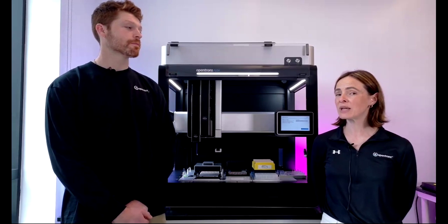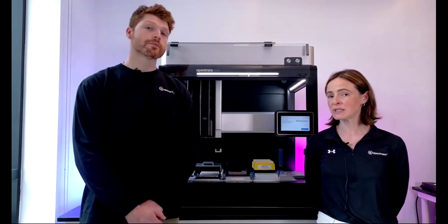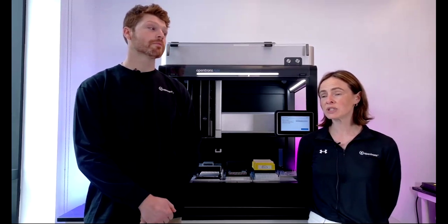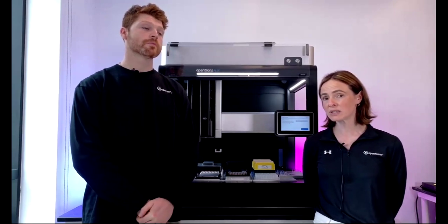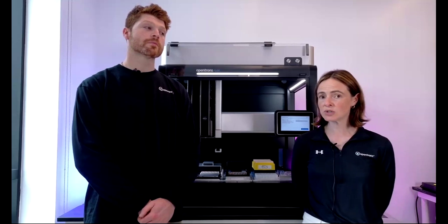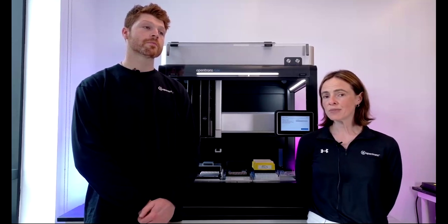So it really depends on the parameters that you're working within and how accurate your pipetting needs to be. I will say the calibration is now a very easy and very automated process on the Flex. For each piece of hardware, it is really a two-minute process. So if you do want to do it very regularly, it is possible. But I think it really depends on your needs.